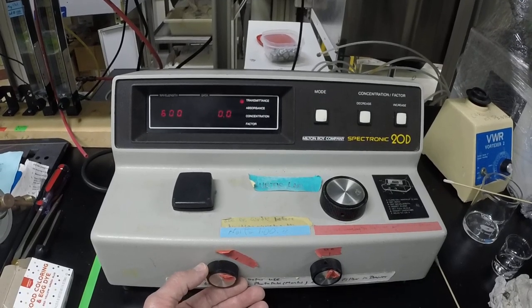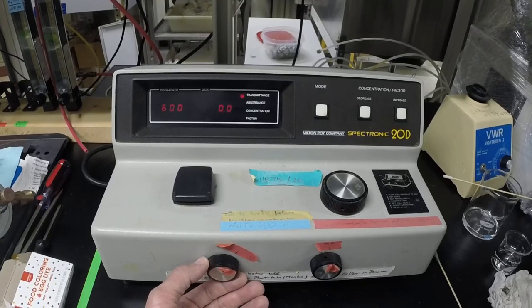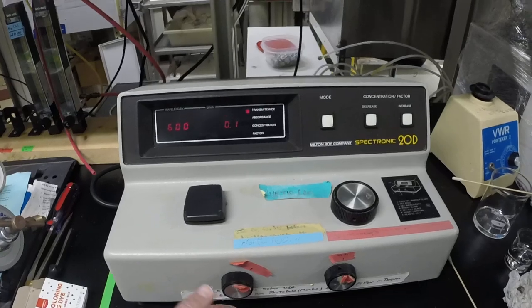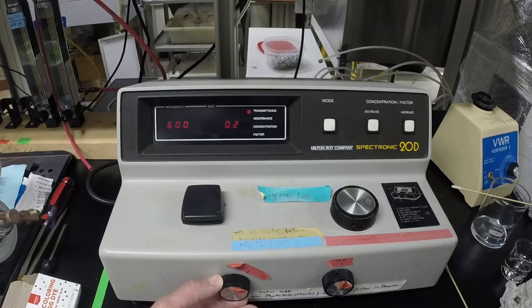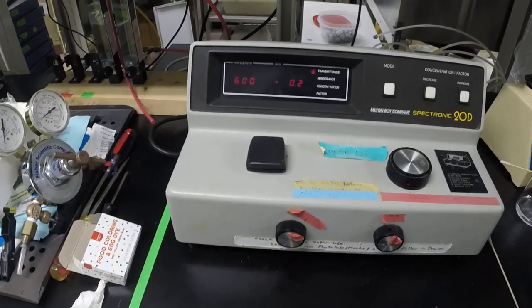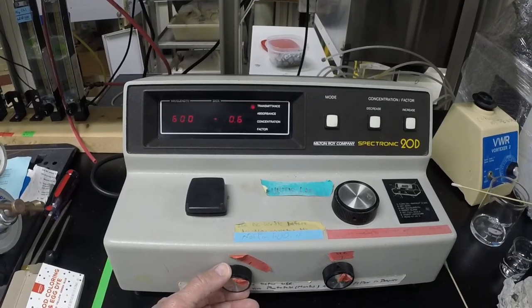And it can be a little bit touchy, but keep in mind we're doing optical densities here. Typically we're looking for readings that are close to one. So point one isn't that far off. We're also not warmed up here. At the moment it would be more stable once it is warmed up.